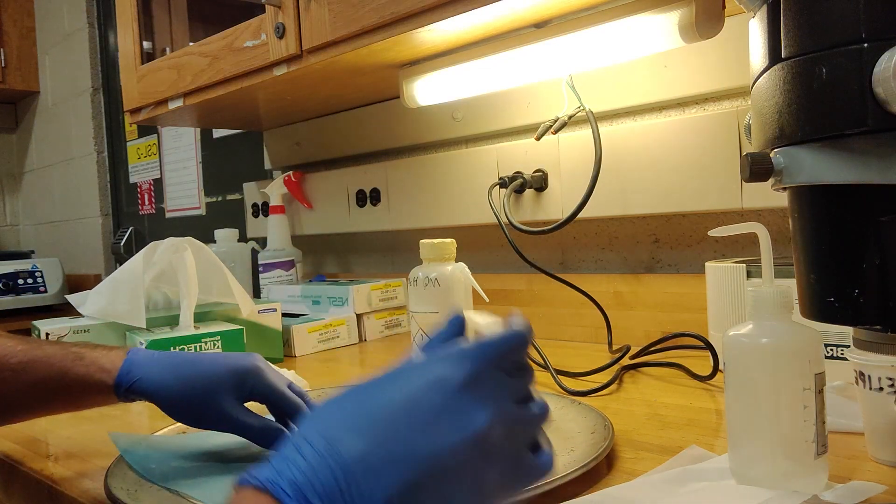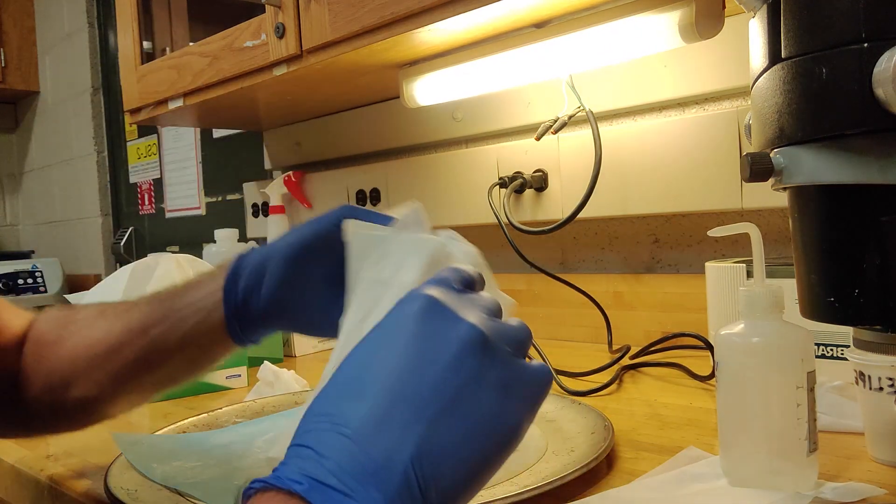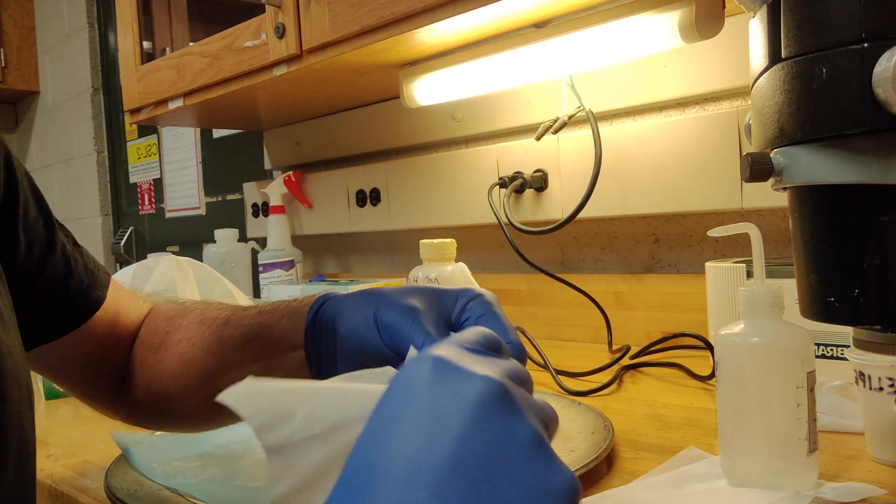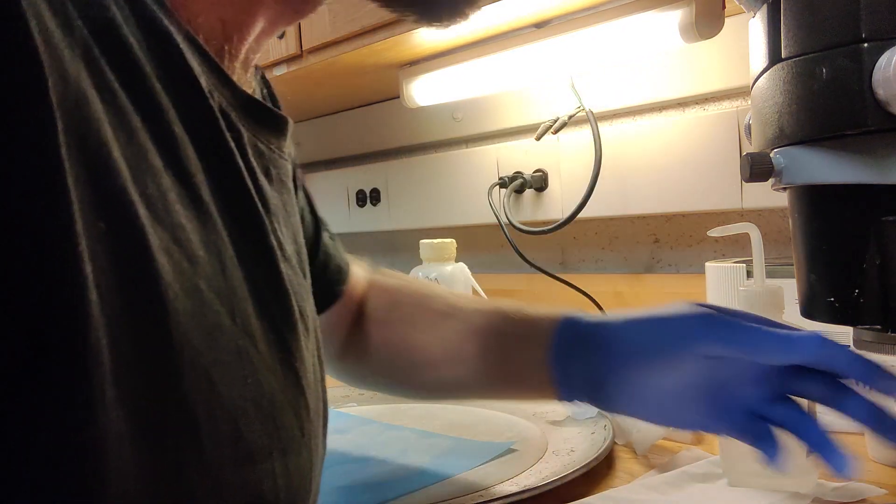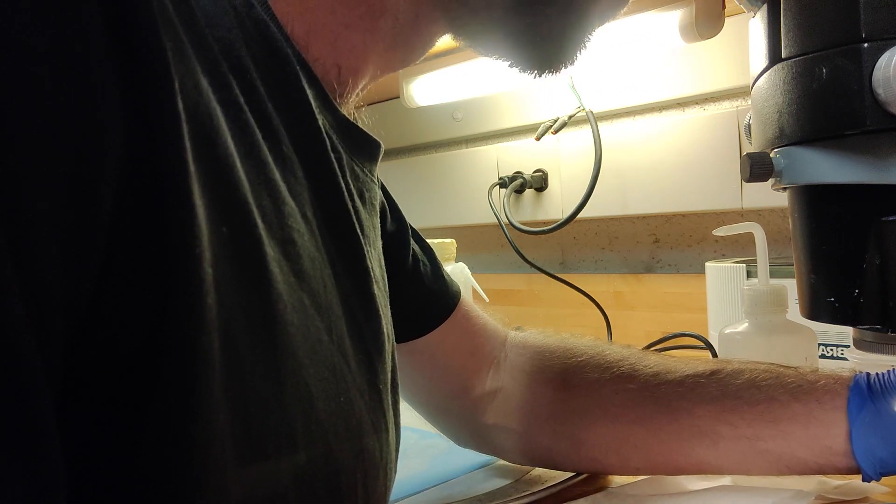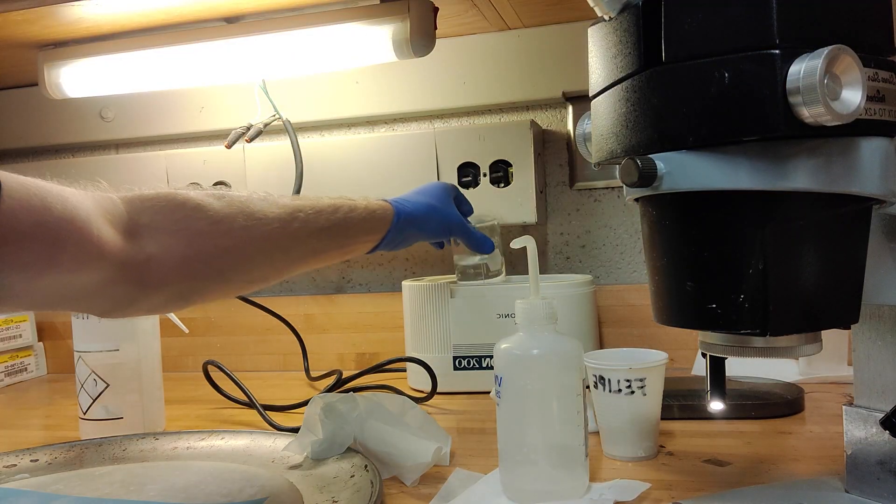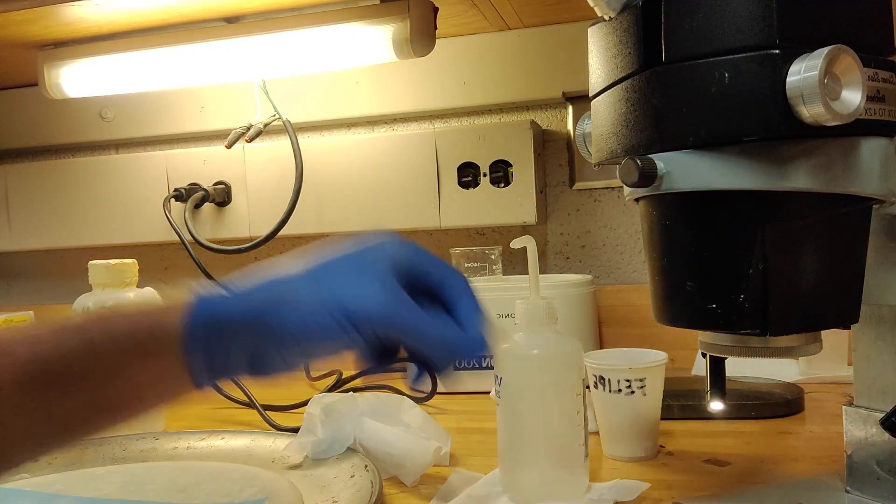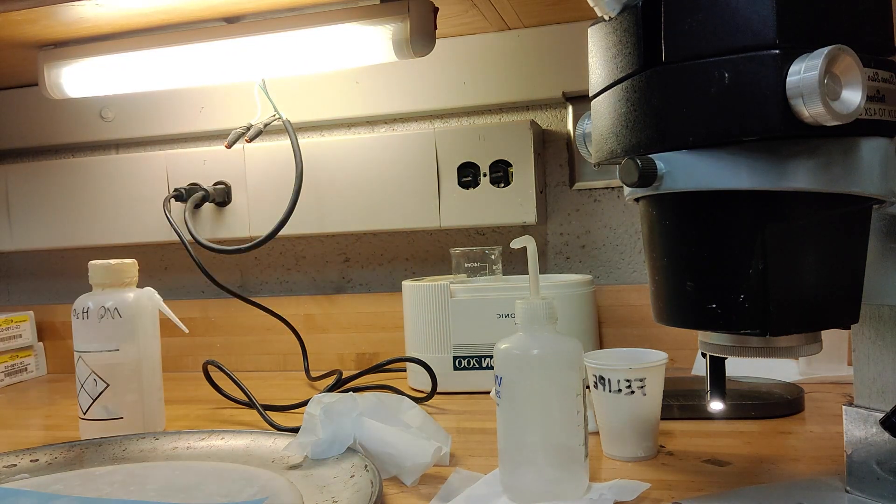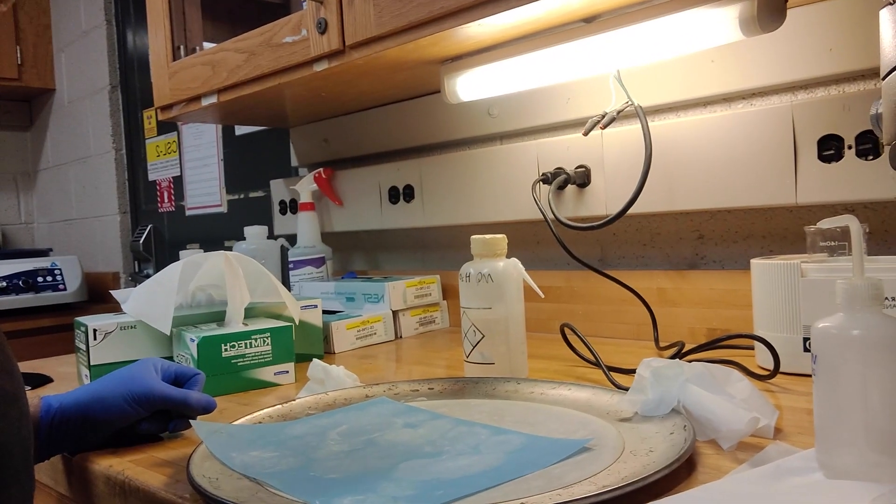After that, when you're done, just give it another clean and then check that polish under the microscope. Hey, this one's done a really good job. We've exposed the grains. It shouldn't really take that long. Basically when you're finished, you just plop it in there and then switch it on. And then once it's done, we're ready for the fine polish.